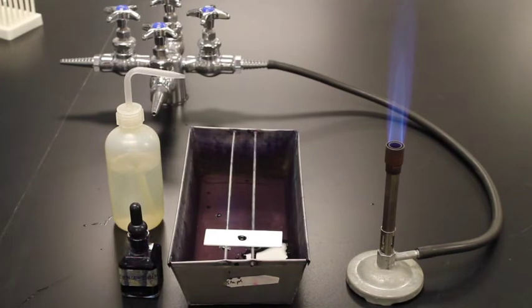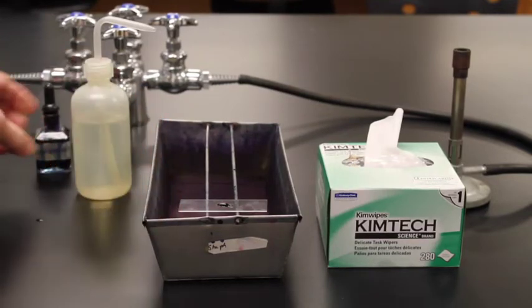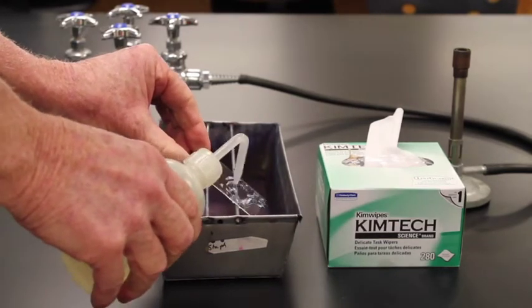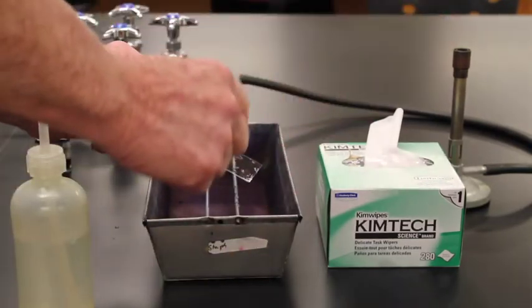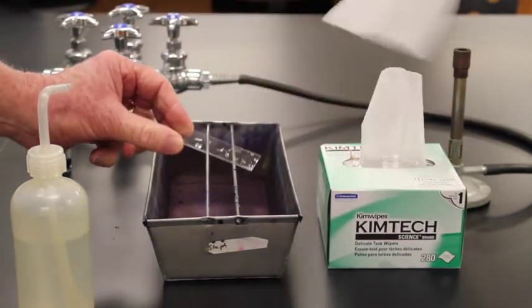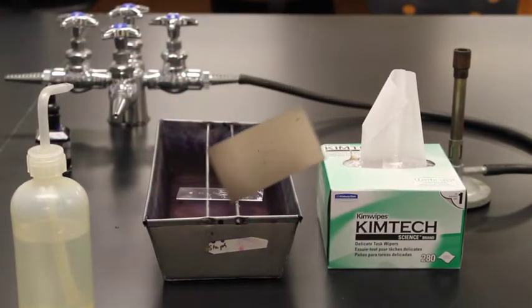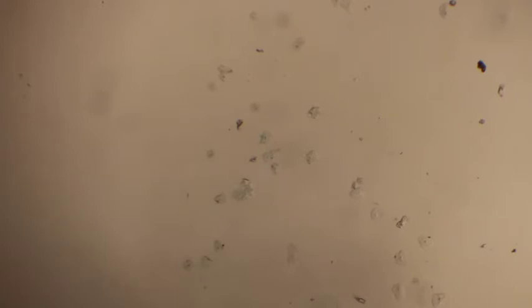Now we want to look at the cheek cells. Here's a view under the 4x magnification of the slide we just made. These cells are stained with methylene blue. We can see little tiny cells in there and each of them has a little black dot — that little black dot is the nucleus.